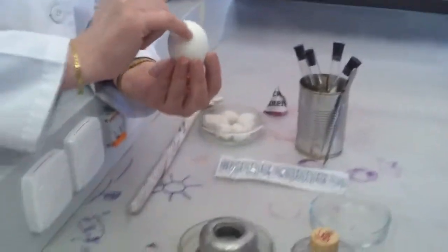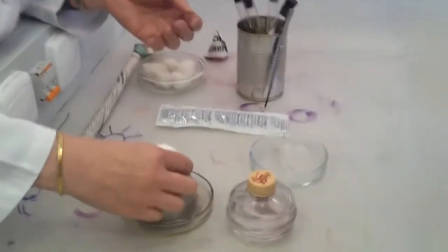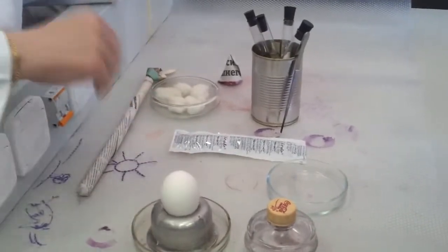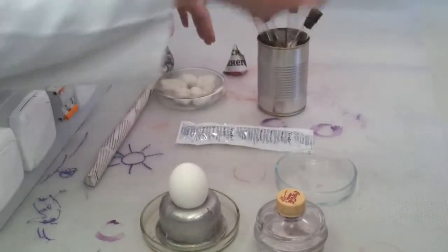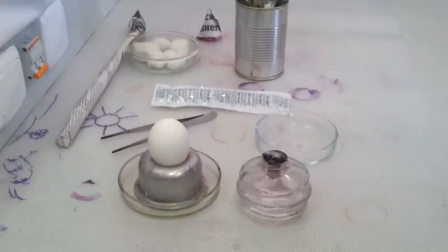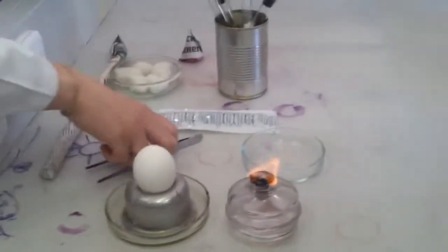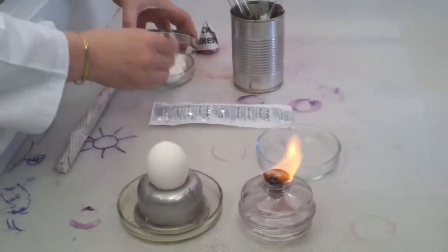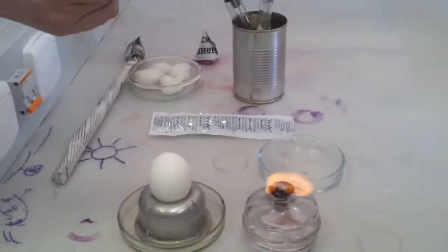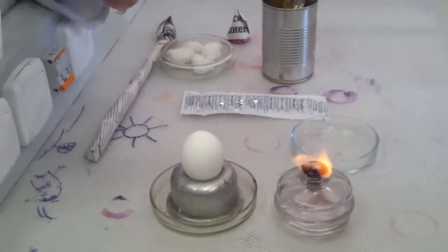The obtuse side will be on top. We'll examine it. First of all, we need — oh sorry, my burner. We need the burner. So first of all, we clear the zone where we work. This is familiar — this is the alcohol.